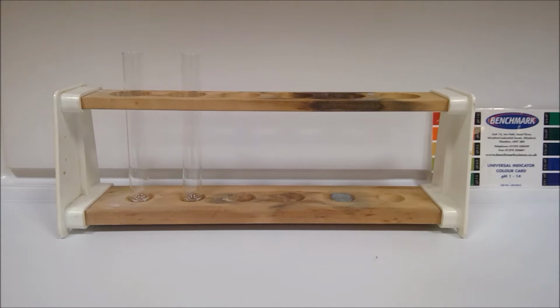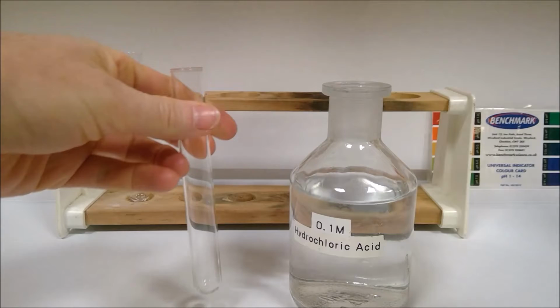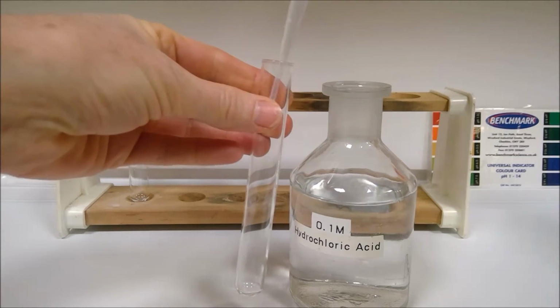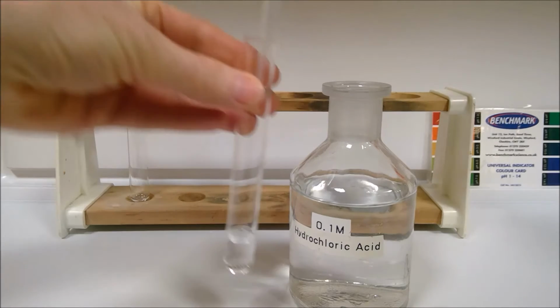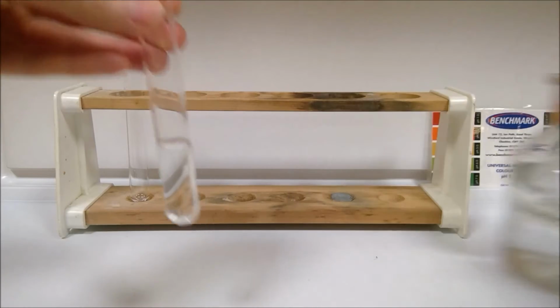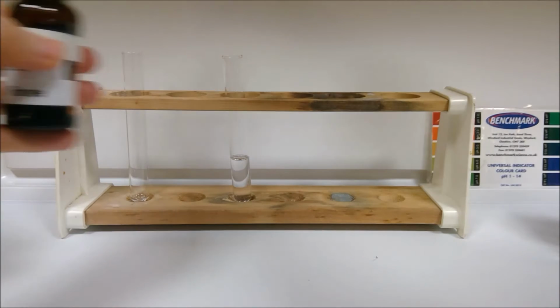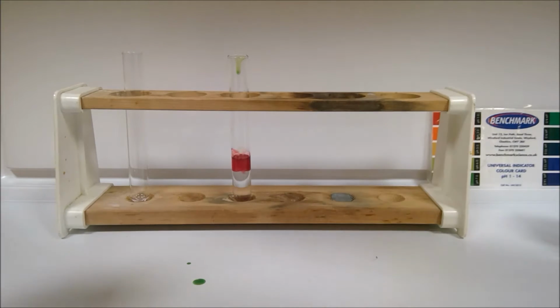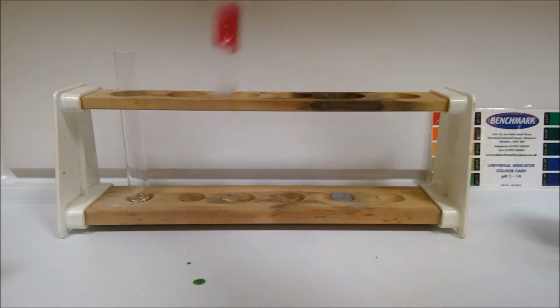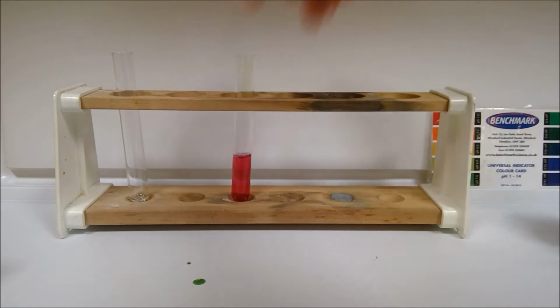So in part B, we need to collect some dilute hydrochloric acid in a test tube. So I have my test tube, hydrochloric acid here. And then I'm going to put universal indicator in and add a spatula of magnesium oxide. Oops, spilling there. Okay, so hopefully that colour was as expected for our hydrochloric acid. Then our magnesium oxide.